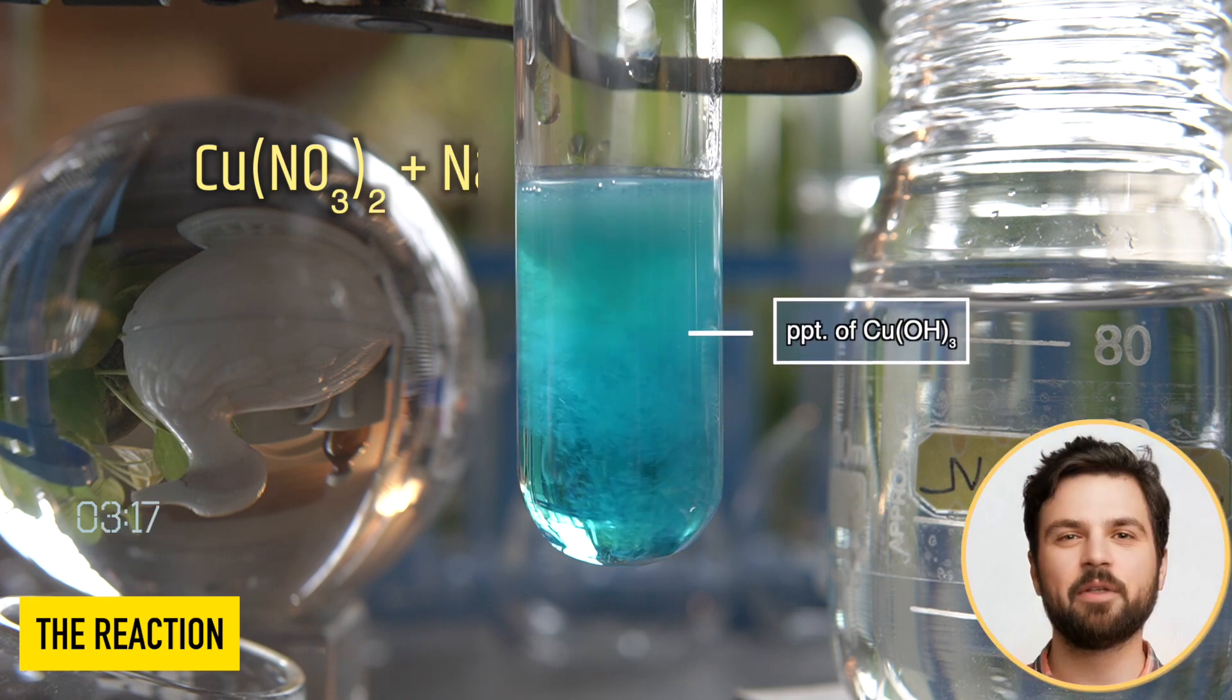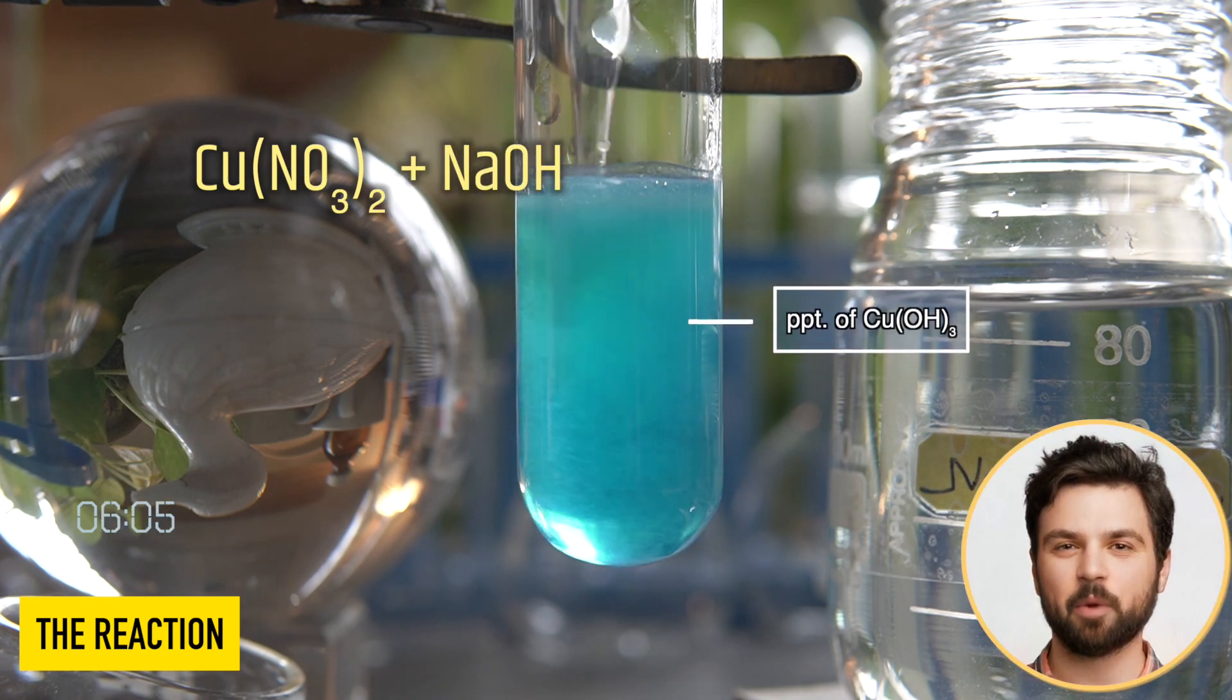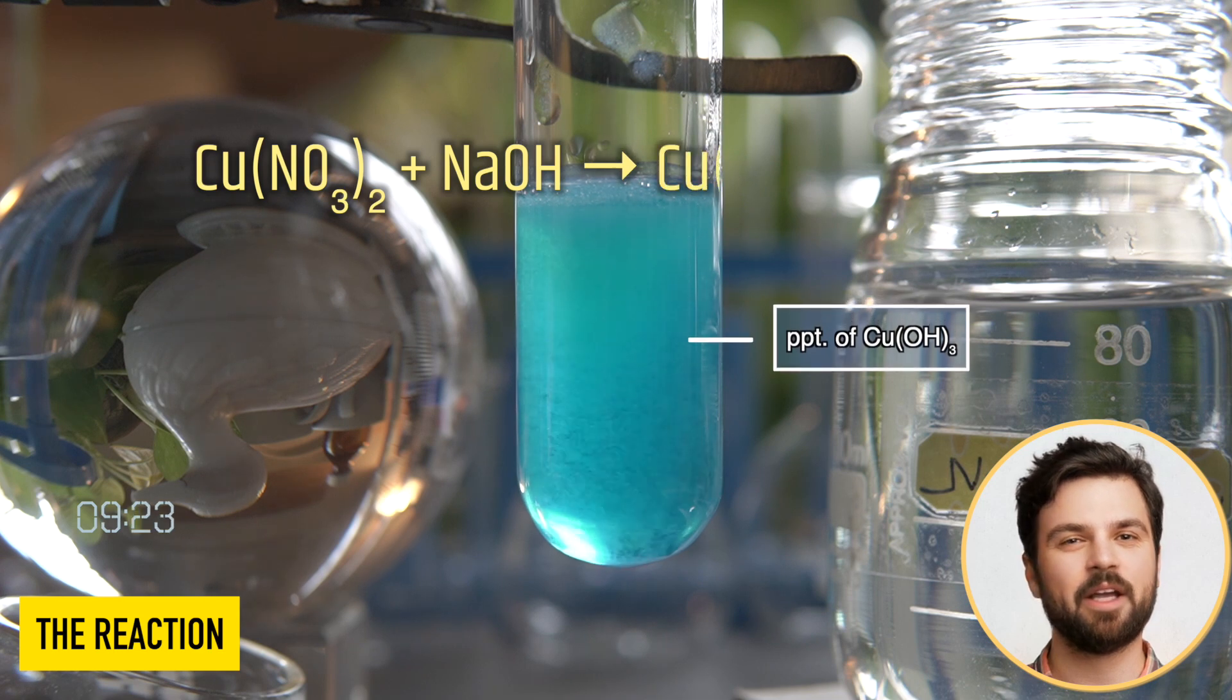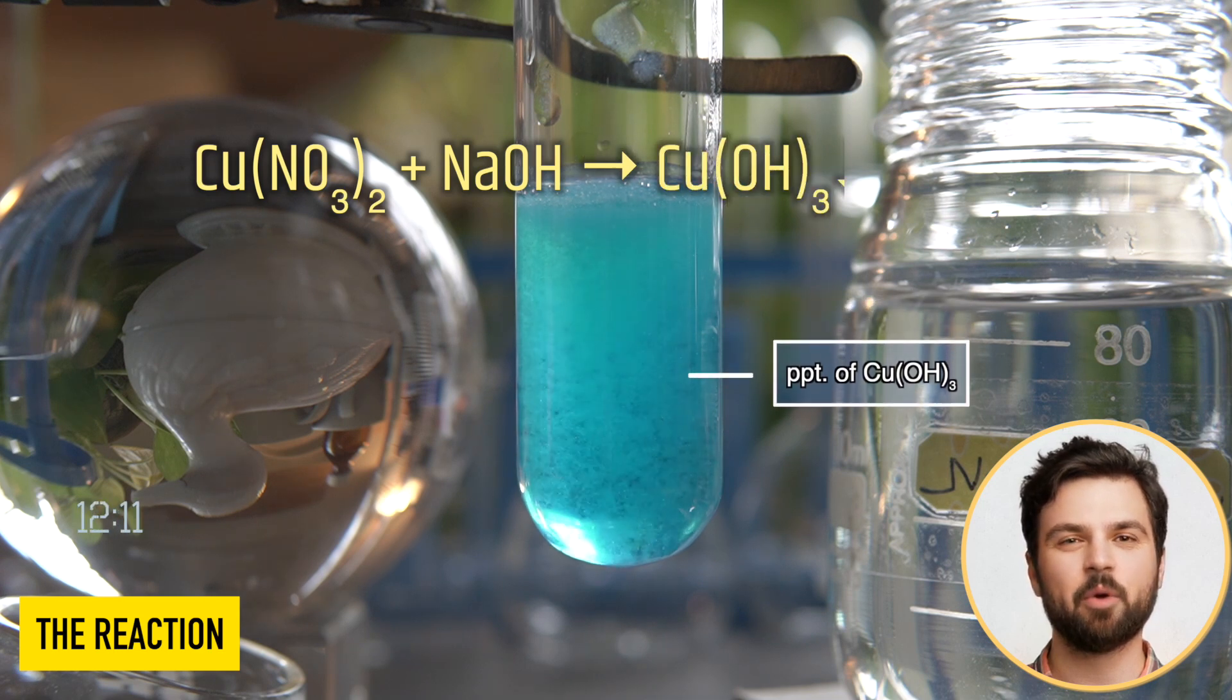So, in this reaction, copper nitrate reacts with sodium hydroxide to produce blue precipitate of copper hydroxide and sodium nitrate.